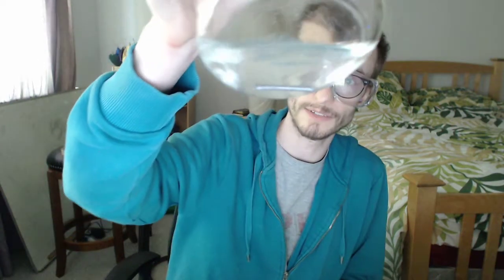It's also starting to smell a little bit, which you guys can't experience. But it's definitely bubbling. And it slowed down a little bit because there's only a thin layer of zinc on the outside of this.